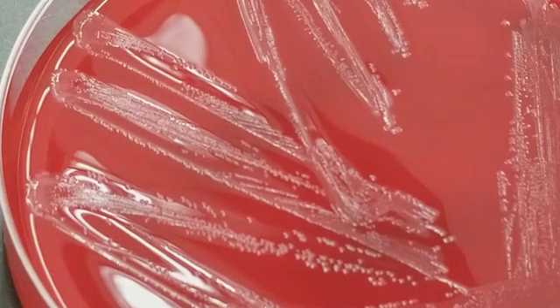That's Streptococcus agalactiae. What we're concerned about with this type of organism, if this was from a pregnant lady, is her giving birth and passing this on to her newborn, because as the baby travels through the birth canal, they are exposed to all different sorts of microflora, and if the mother has this, then it can cause really terrible infections in babies, especially meningitis.